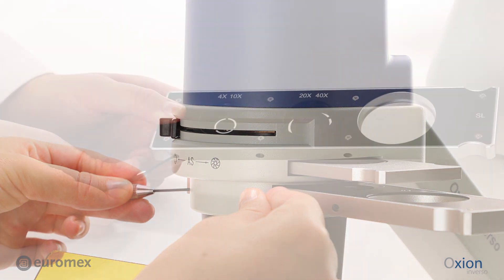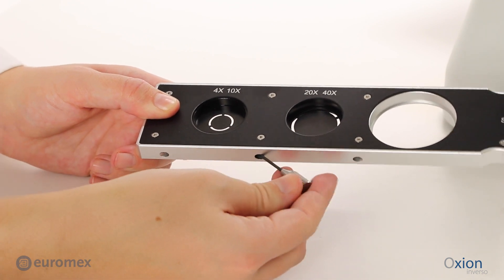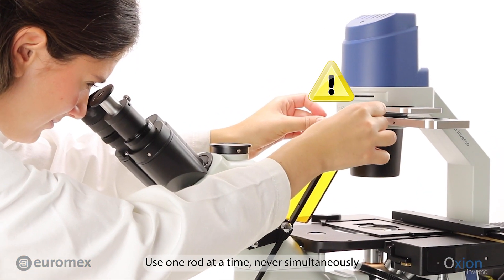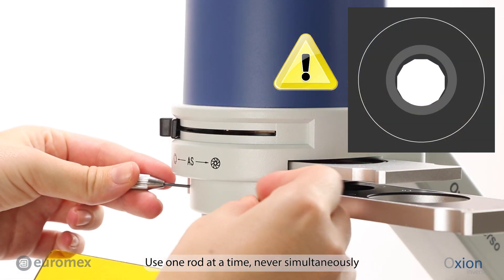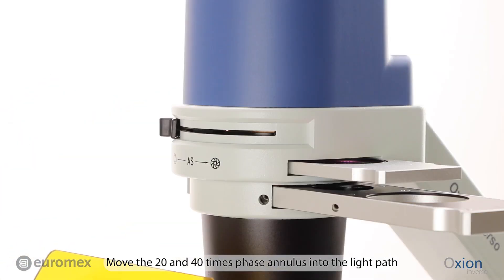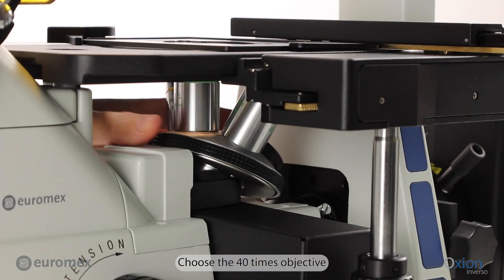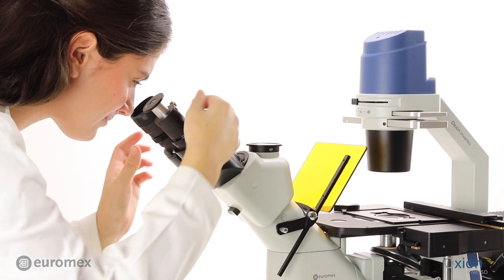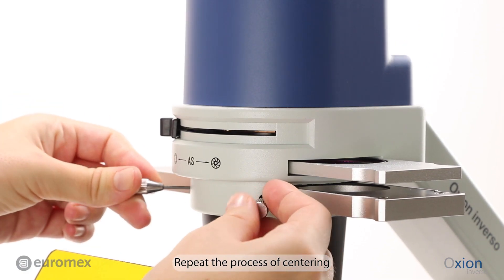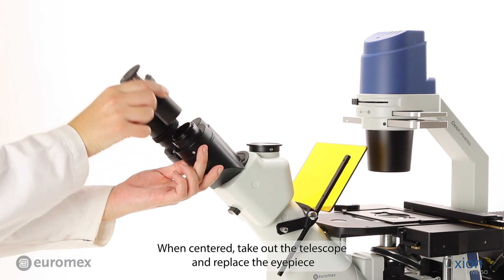Use the rod to position and center the annulus. Use one rod at a time, never simultaneously. Move the 20x and 40x phase annulus into the light path. Choose the 40x objective. Focus the telescope again if necessary and repeat the process of centering. When centered, take out the telescope and replace the eyepiece.